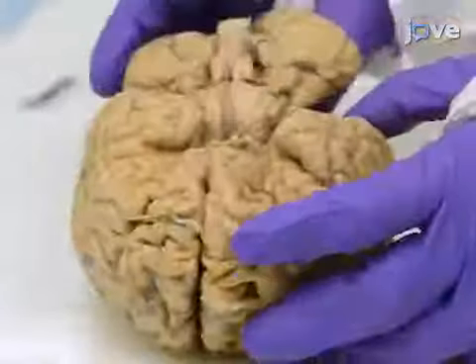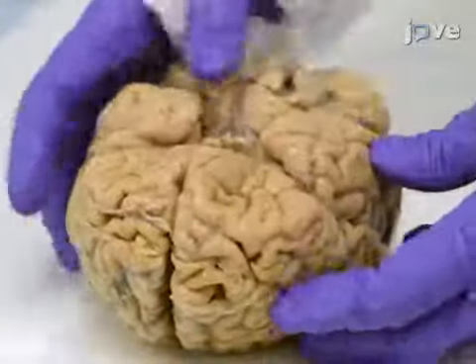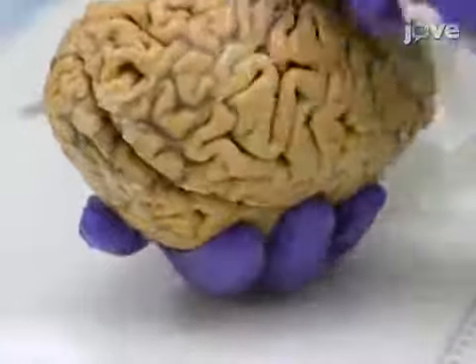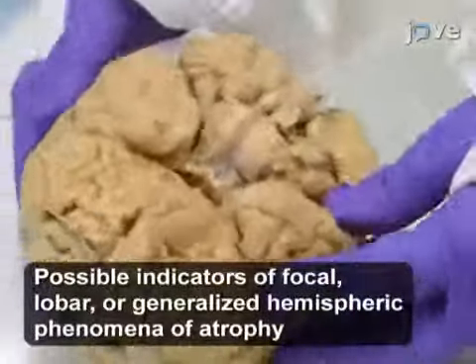Examine the tissue for meningeal anomalies, macroscopic hemispheric asymmetries, macroscopic tissue lesions, congenital malformations, vessel abnormalities, or any other abnormalities or unusual presentations of the cerebral surface.